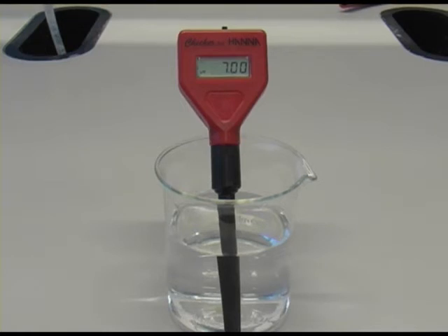A pH meter is a device for measuring the pH of a solution accurately. Here we can see that the pH of freshly distilled water is 7.